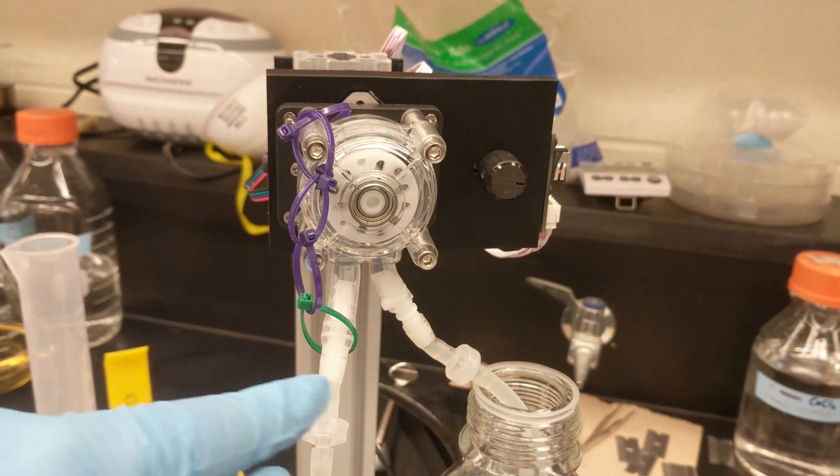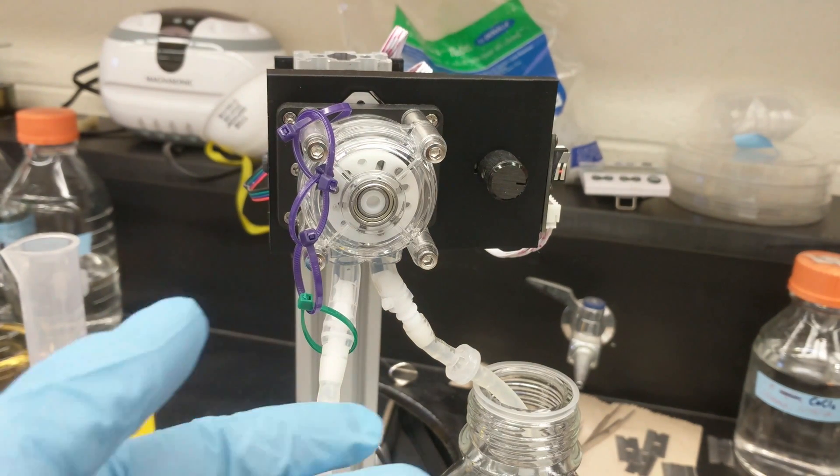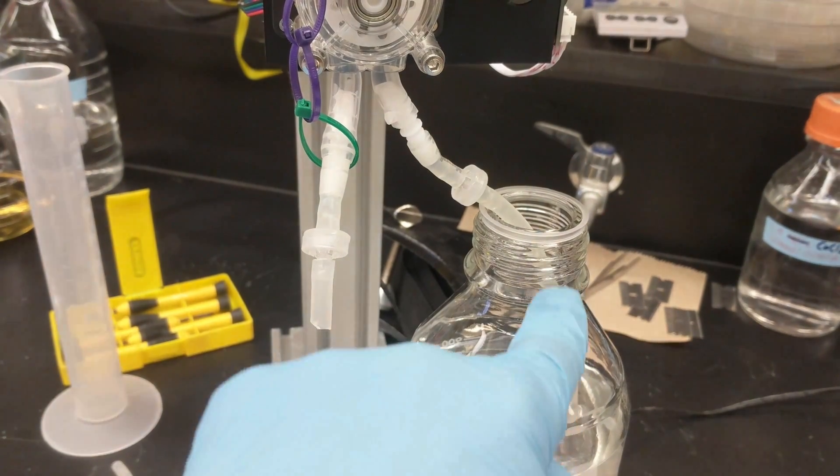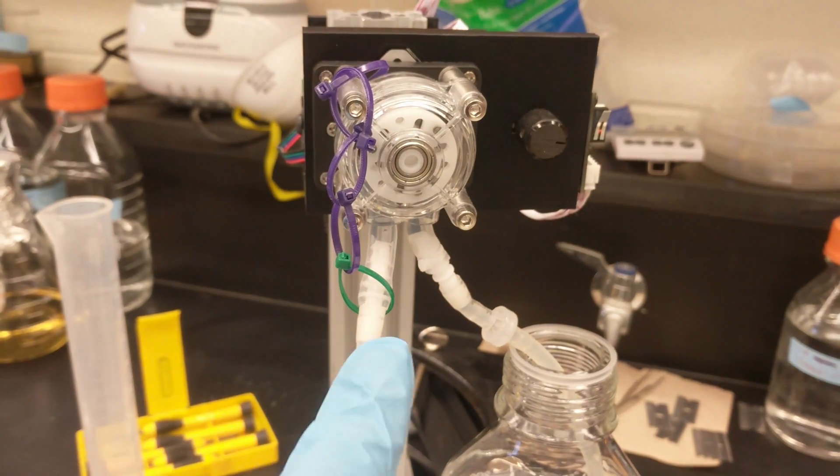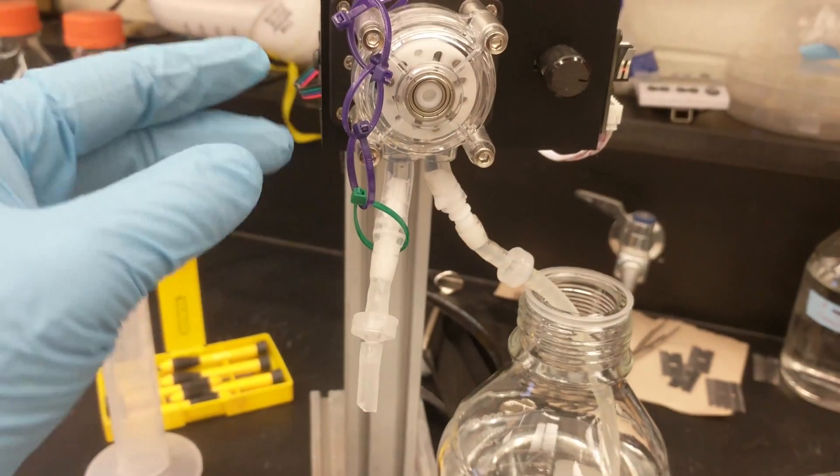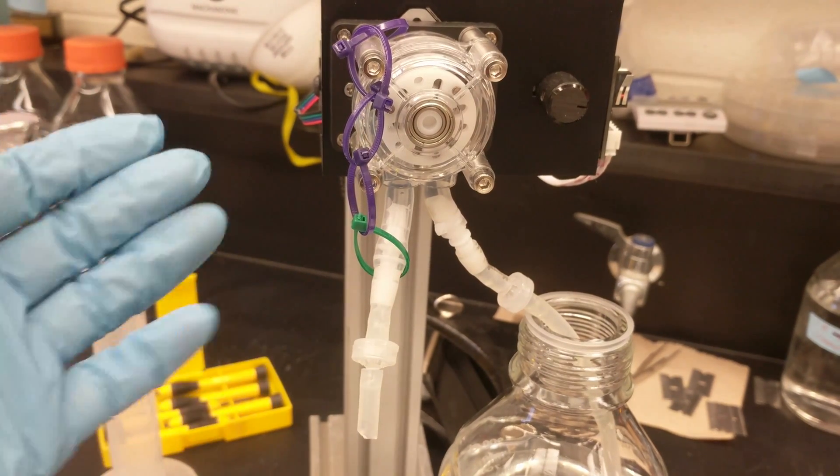The error comes in when you have bubbles coming in through here, so when you use this kind of a system you have to make sure that you purge all the air from the line before you start using it properly. And yeah, so I tend to use this primarily for buffers that we use a lot of, so for electrophoresis and westerns and stuff like that.